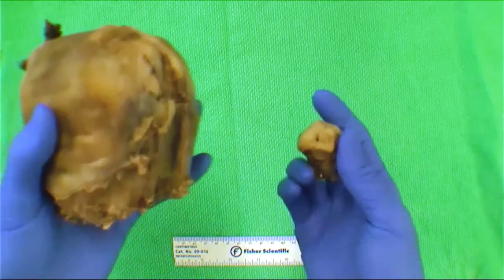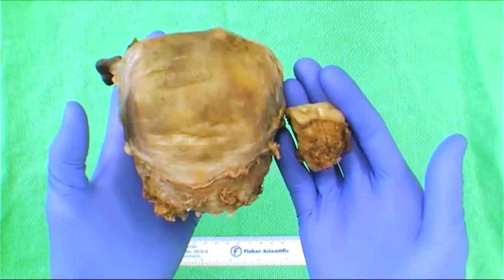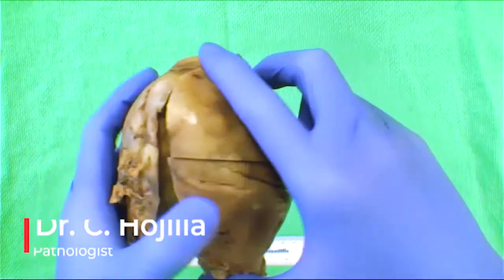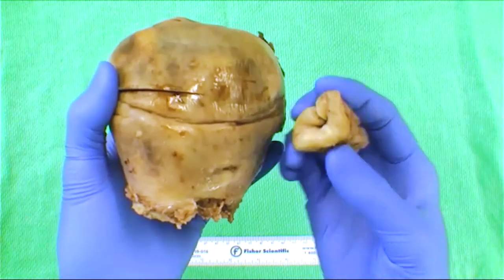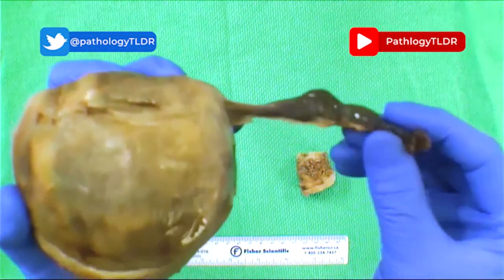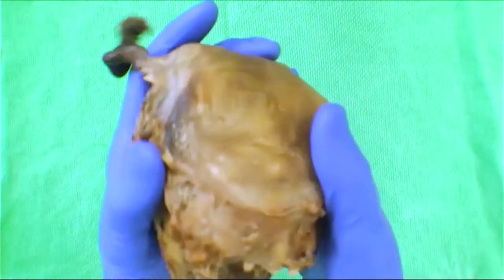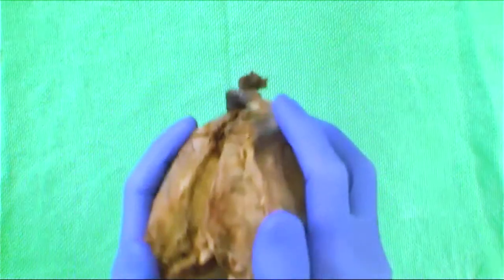We'll jump right in — hope everyone's doing good. We'll show you this specimen and then proceed with our first poll question. I'm going to put up the question: what organ or specimen is this?